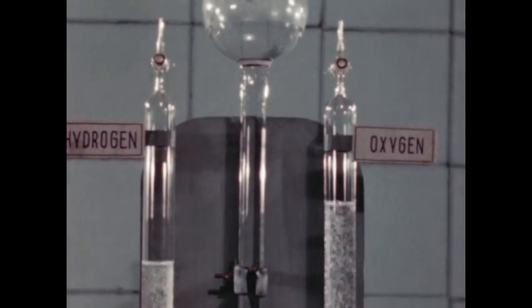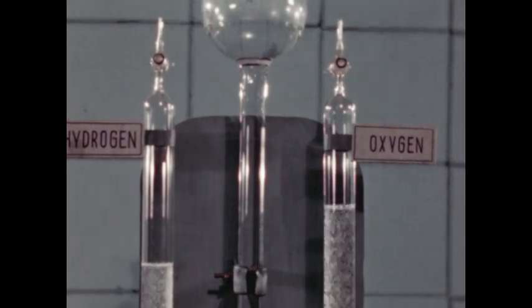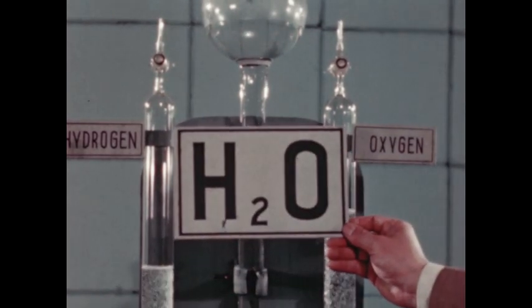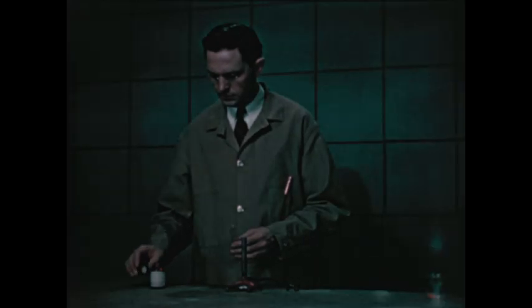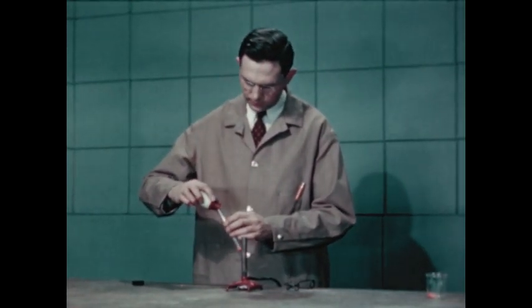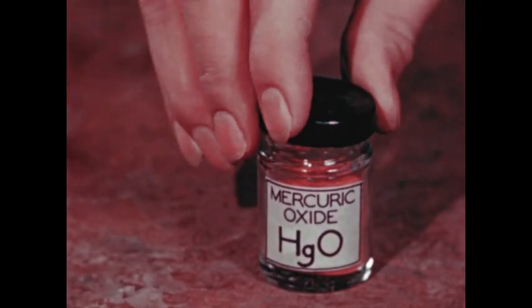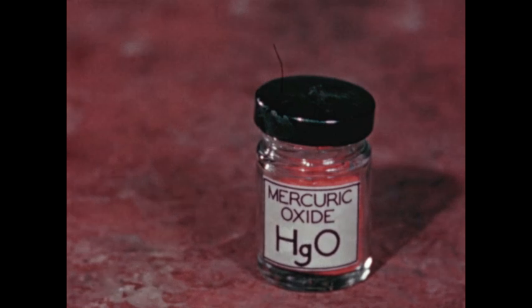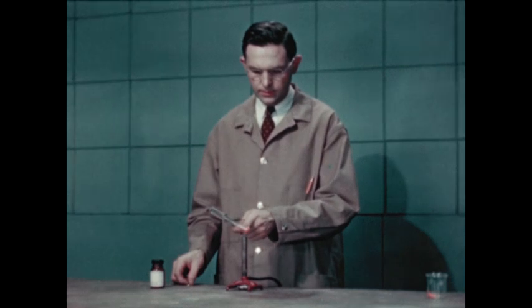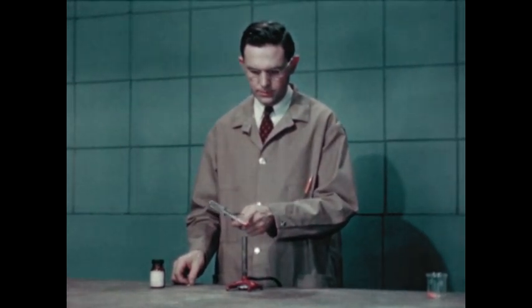Two atoms of hydrogen and one atom of oxygen make up each molecule of the compound water — that's why we write the formula of water as H2O. We have seen an electric current decompose water and release oxygen. Now we shall observe the effect of heat on another compound, mercuric oxide. Heat decomposes the mercuric oxide, releasing the oxygen gas and leaving the pure element mercury.